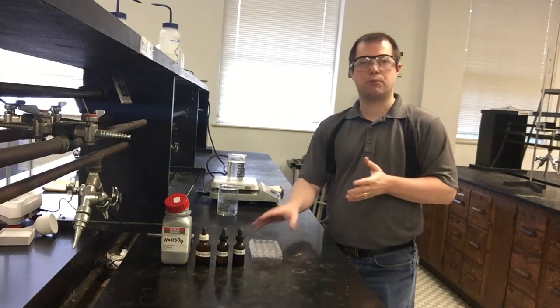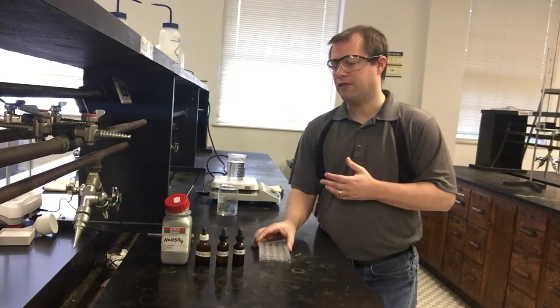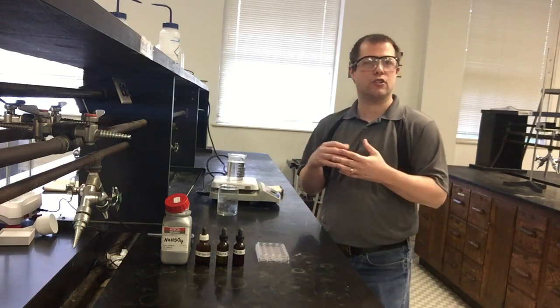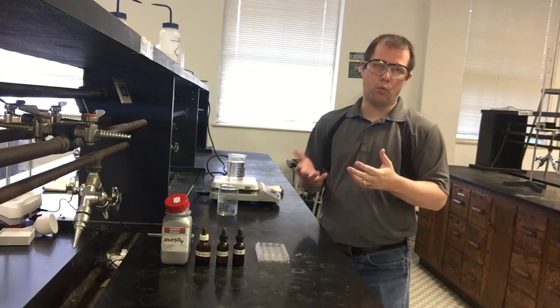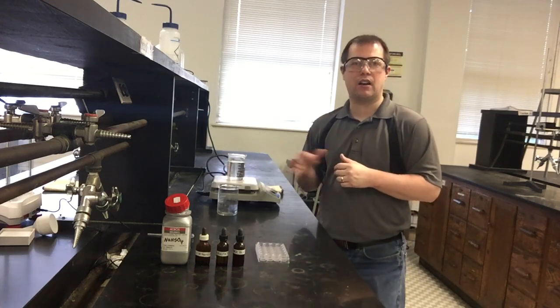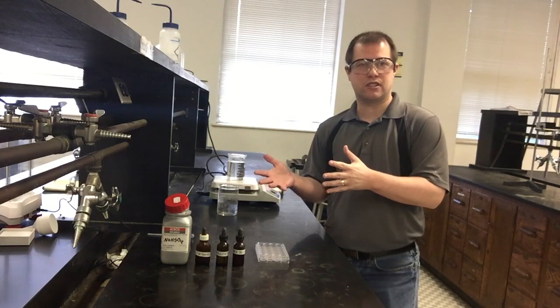Generally, we're going to be doing all of our reactions small scale in one of these little well plates. We have different dropper bottles with all of our reagents for the reaction itself, and then also the added pieces that we're going to be adding to our reactions to see what happens to our equilibrium as we make those adjustments. And then I do have an ice bath and a hot water bath over here as well, so we can take a look at how temperature changes things also.